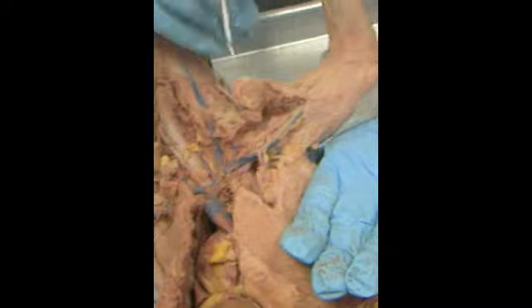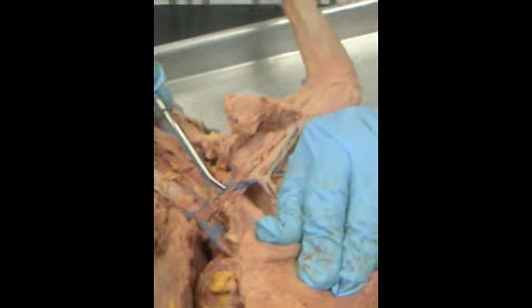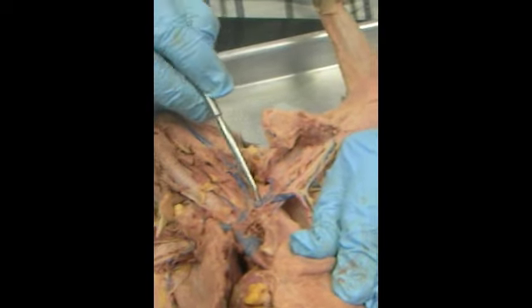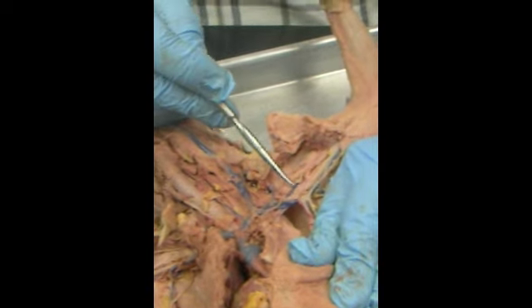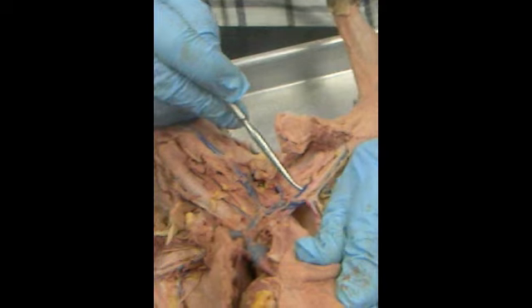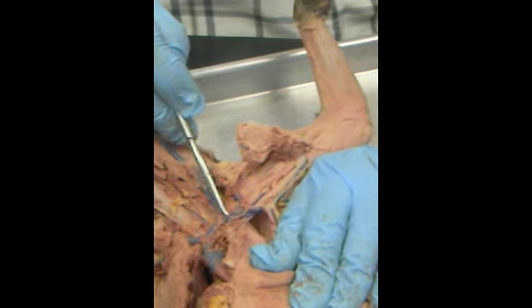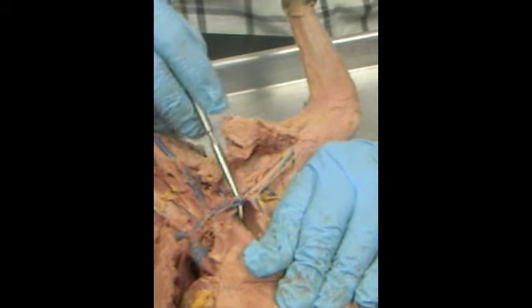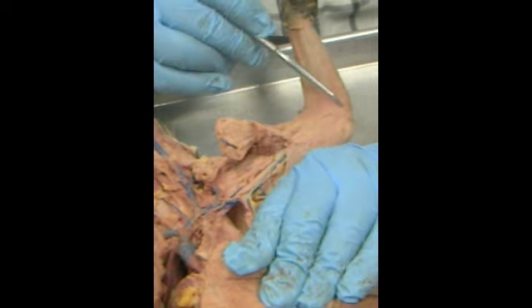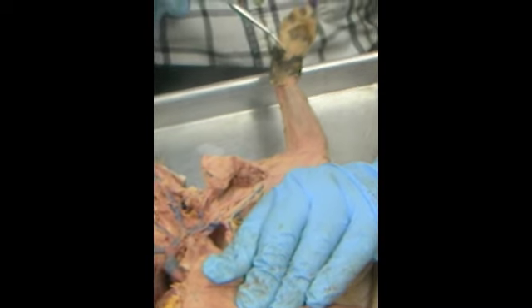If you look at the left arm, which is quite nice too, again, brachiocephalic, because the jugulars came off, that's now the subclavian. Here's one going deep, you can see it nicely. Subscapular, so the subscapular comes off the subclavian, alphabetically. Now that's the axillary, armpit, and then this is the brachial. The brachial would go down and become the ulnar and the radial. And that is enough for anybody.